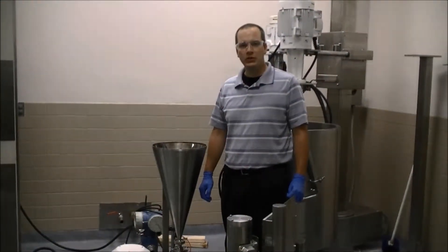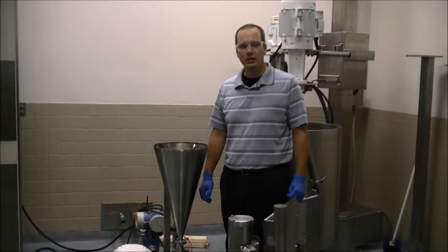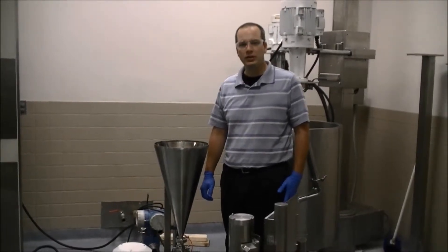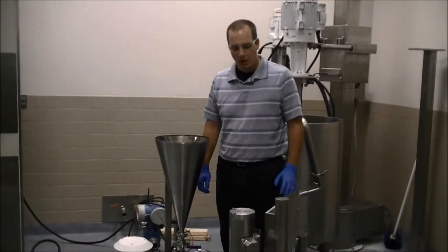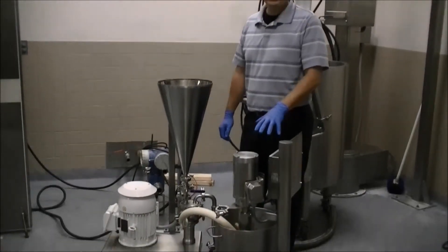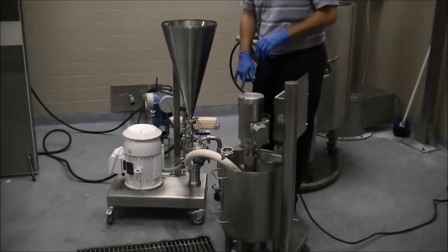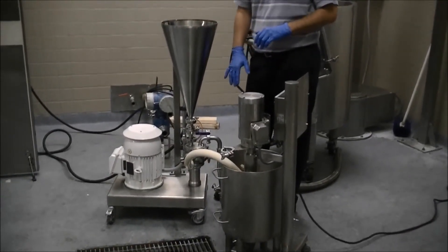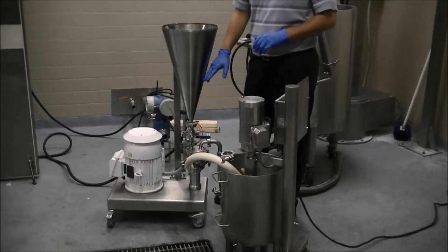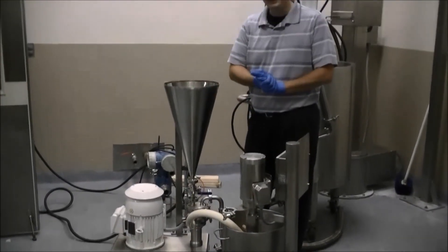Today we're going to be dispersing carbon into a blend of motor oil and surfactant using our ZC0 powder disperser. We've got our pre-blend of the surfactant and oil in our tank here, and we'll be recirculating using a flexible impeller pump through the ZC0 and then back to the tank as we disperse.